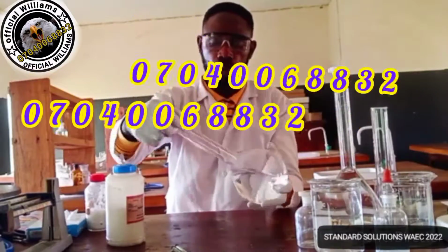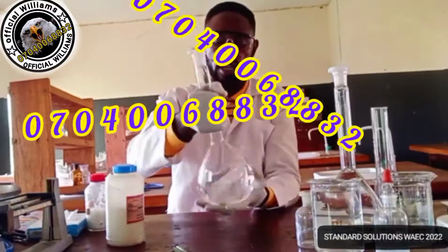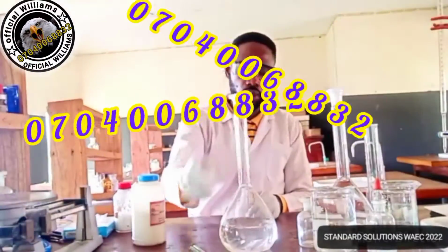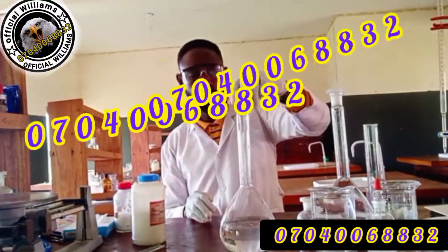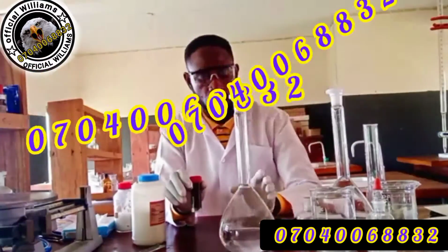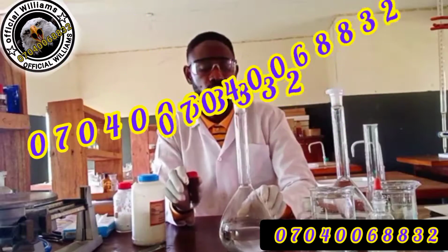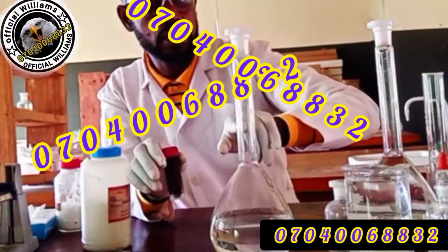Don't allow the liquid to pour out, because you already added some potassium iodide and you'll be losing some of it. Potassium iodide is extremely soluble in water. All of it is dissolved. So what you need to do now is to bring this iodine crystal and add it into this solution. When you add it, you now make it up to this mark, which is the 1000 mark.